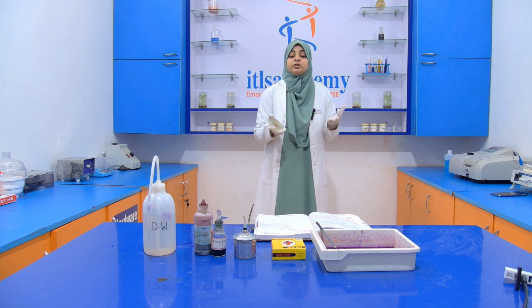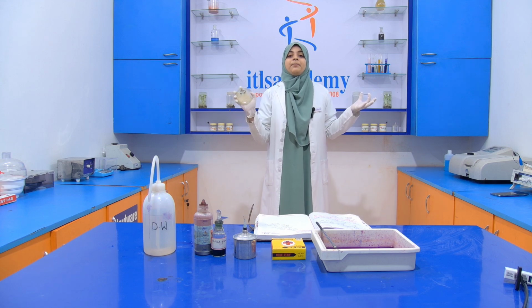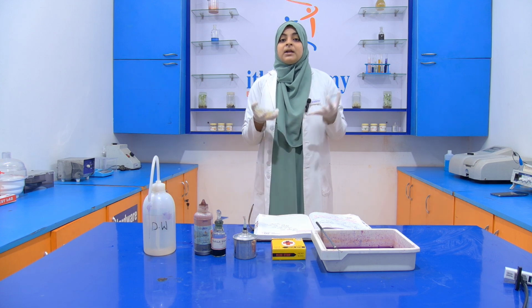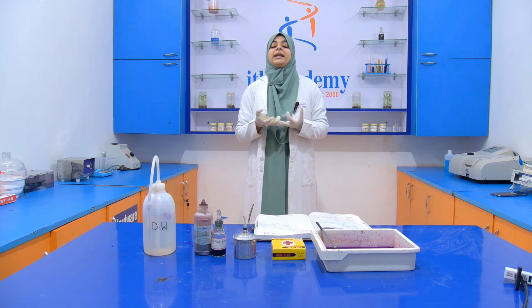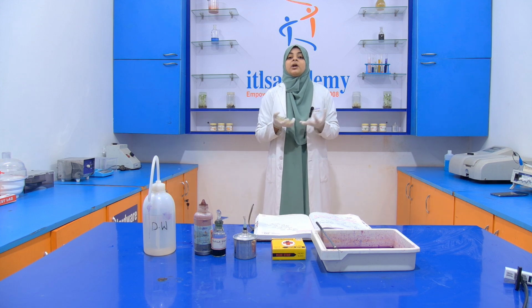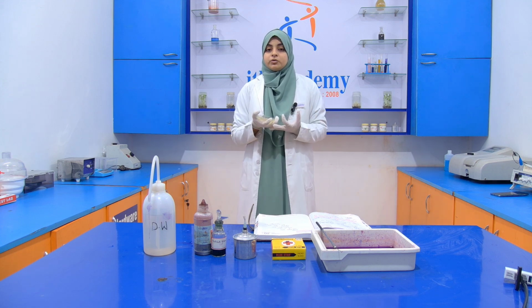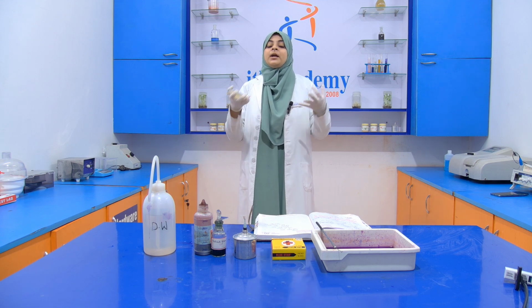After serial dilution, we sterilize the laminar airflow, and then we perform the pour plate method. Videos related to these experiments are already uploaded on our YouTube channel. You can visit our YouTube channel and see those videos, and then you can better understand what we do.